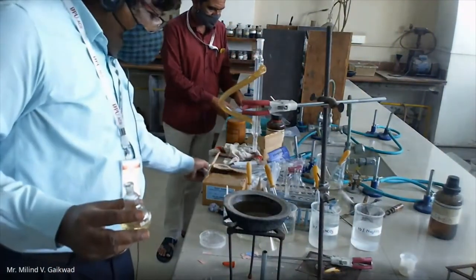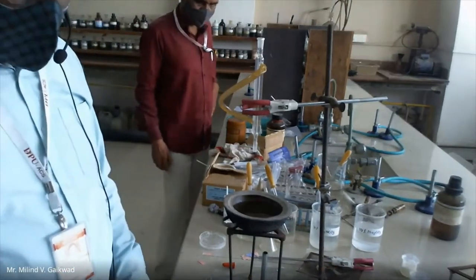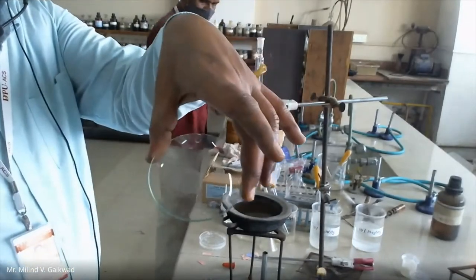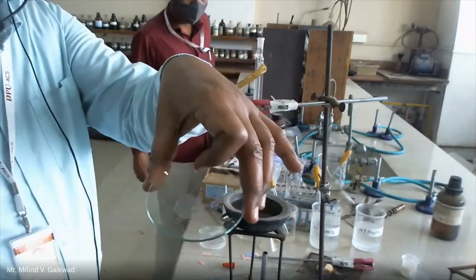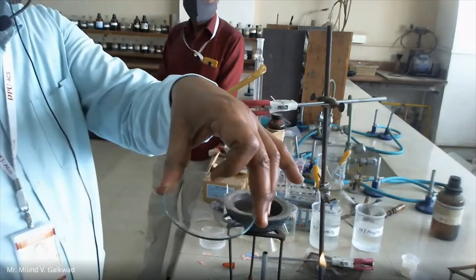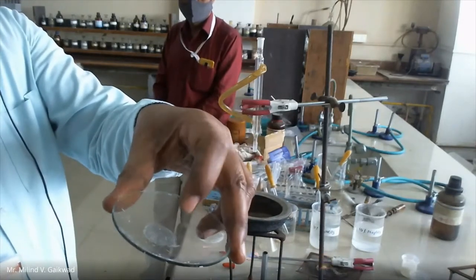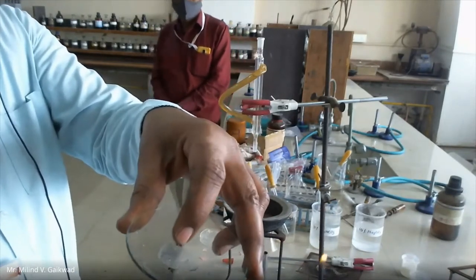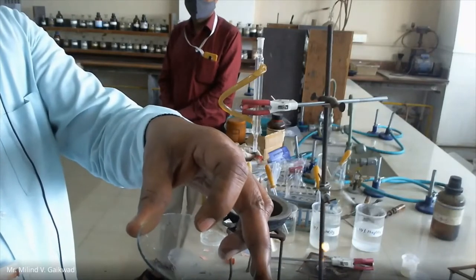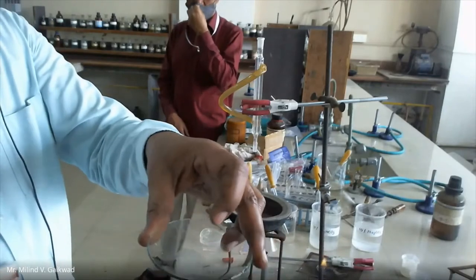If it is solid plus liquid, we have seen that we have to take drops on a glass plate, and after putting these droplets of the solid-liquid mixture on this glass plate, after some time it gets evaporated and on this glass plate we have such type of solid particles. So you may say that it is solid plus liquid.